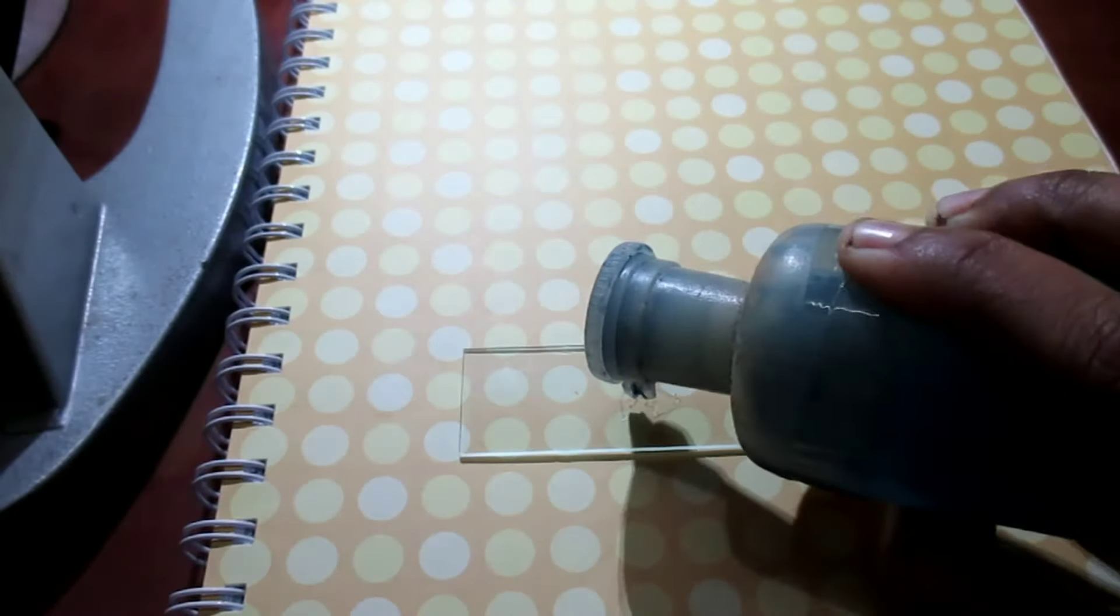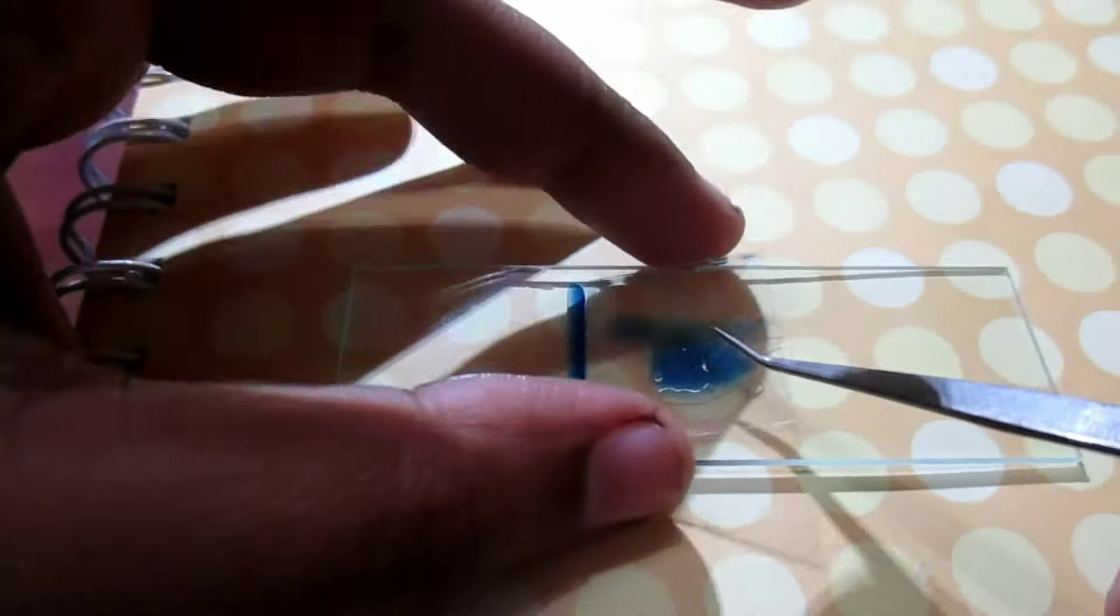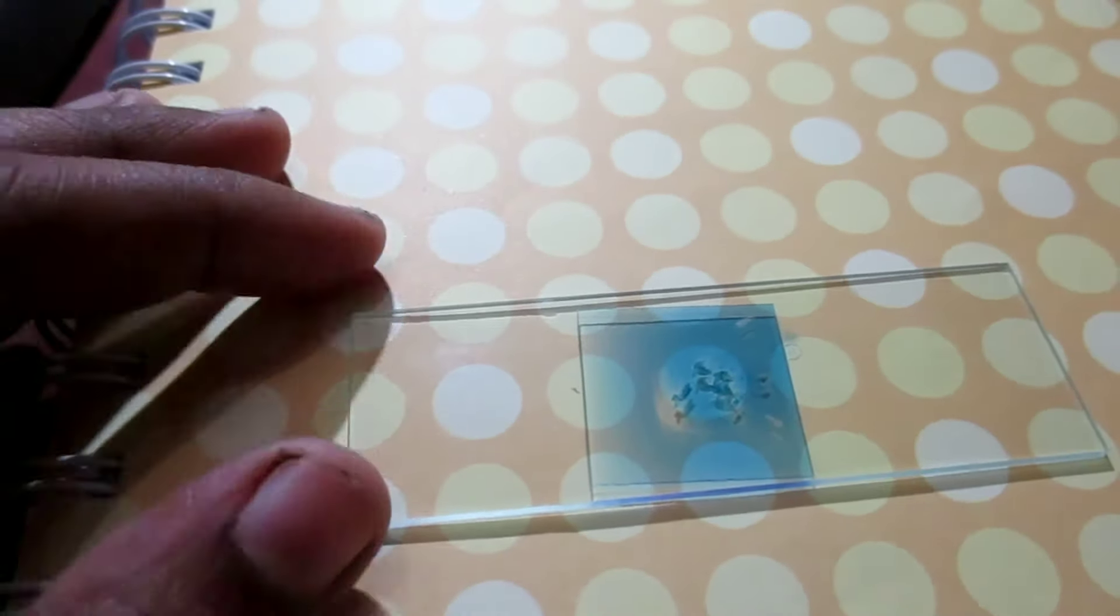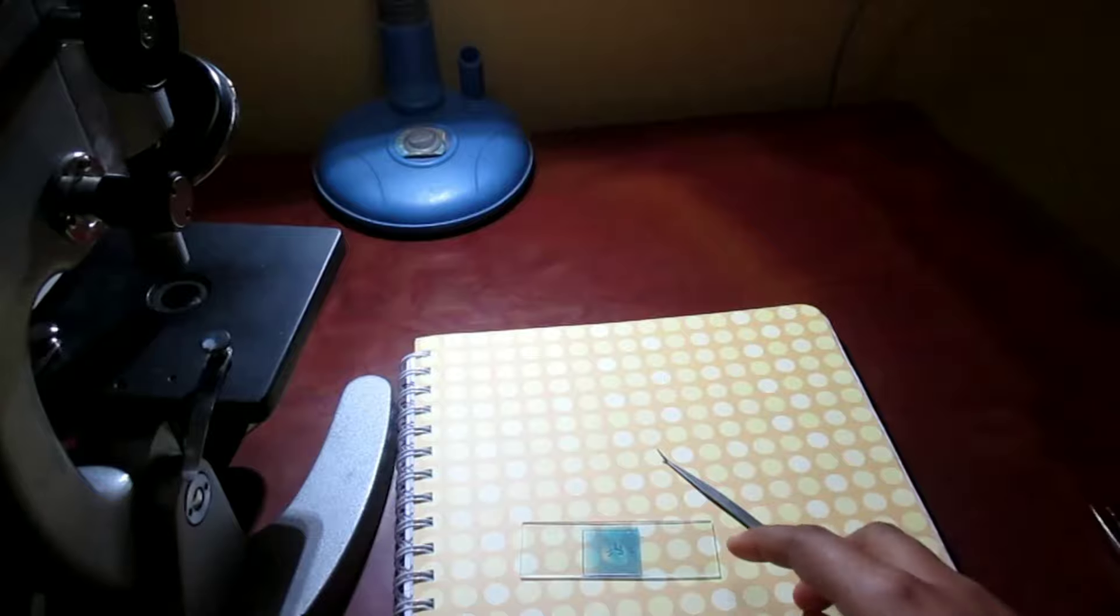It's time for the final step before we are going to put it on microscope stage. Be careful here to avoid air bubbles. Now we are ready to observe, at first in 10x magnification and then we will try 40x.